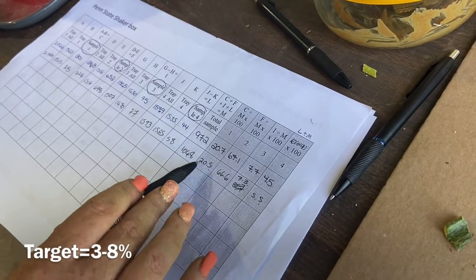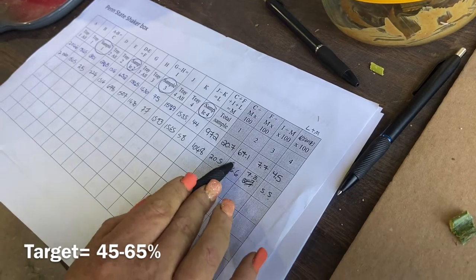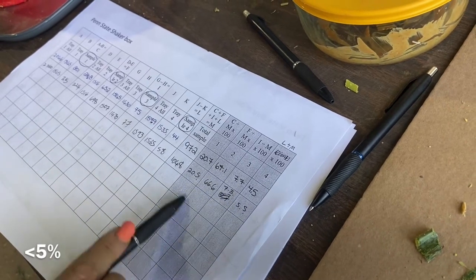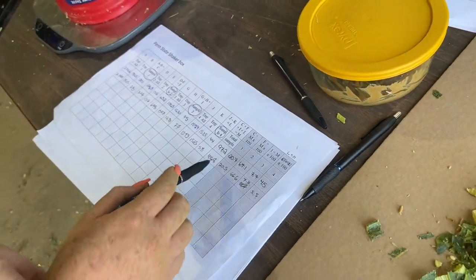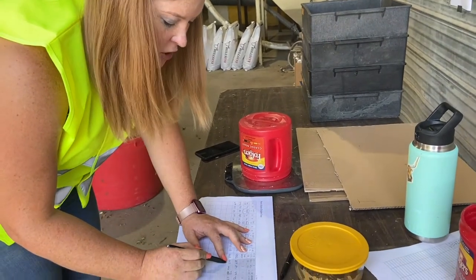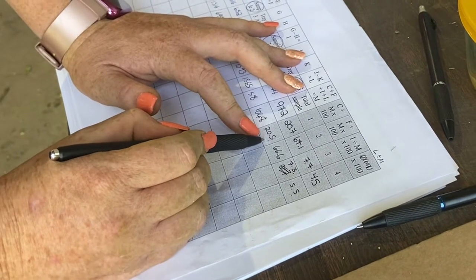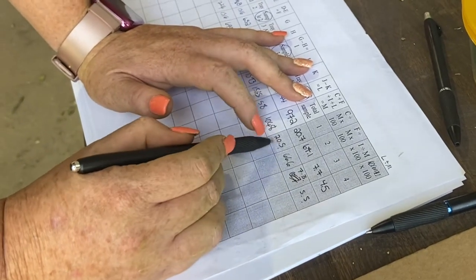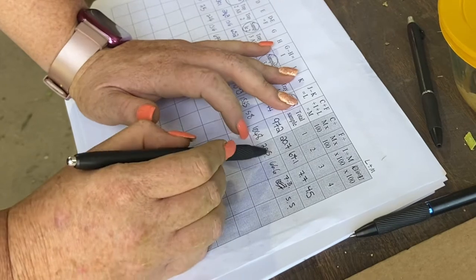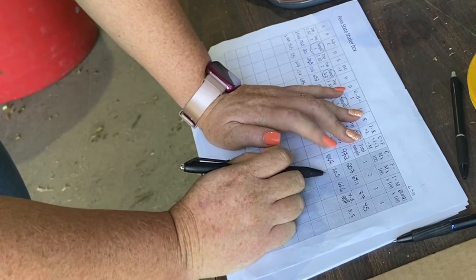We are definitely very high on tray 1. The second tray we want at 45 to 65% — that's just over. The third between 20 and 30, and the bottom one less than 5%. When we mix our corn silage with other things to make a TMR, we don't want too much on the top because it will get sorted out and the cows won't eat it — that's a waste. If they don't eat the top part and there's too much of it, they can get ruminal acidosis from sorting.